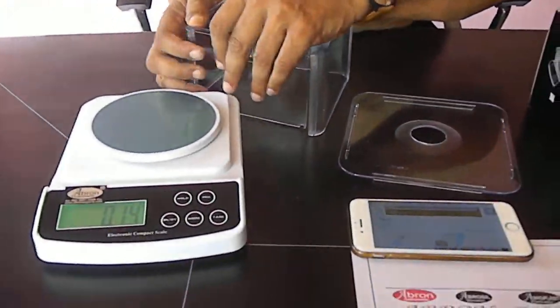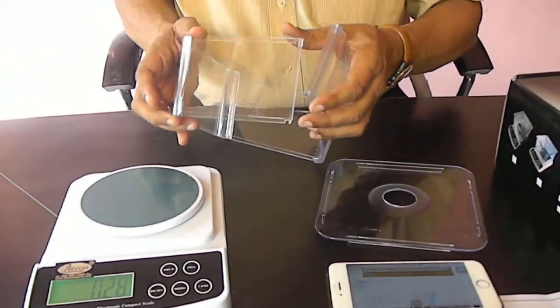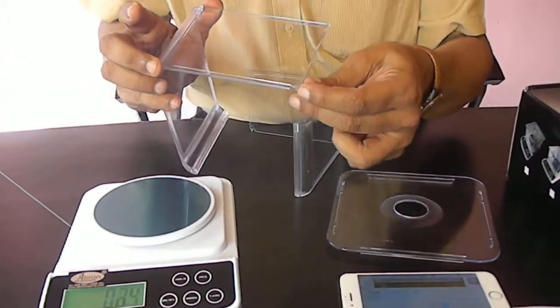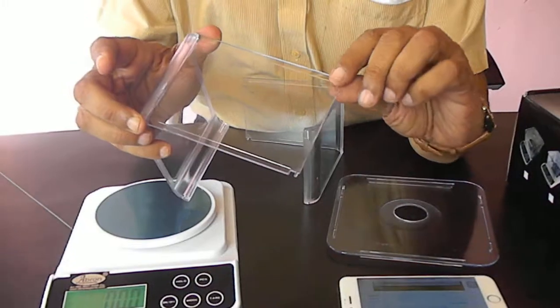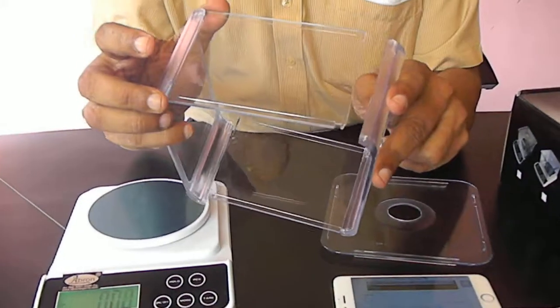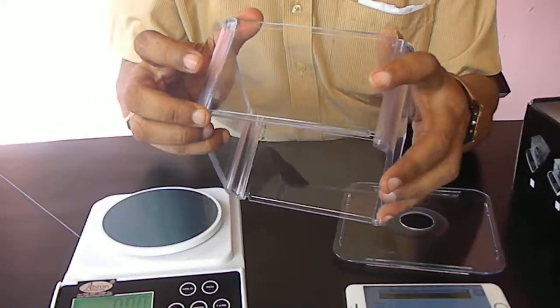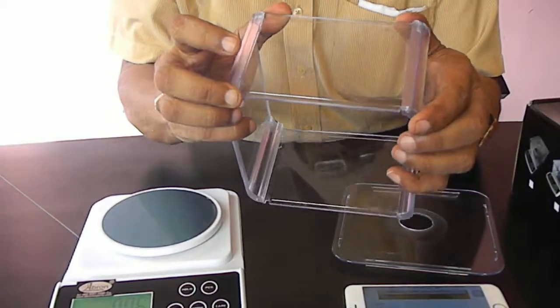It comes with different parts. You can easily slide it. There are two parts. One has a notch here and another is a heavier one. You can just put and push it here. It goes inside and then slide it.